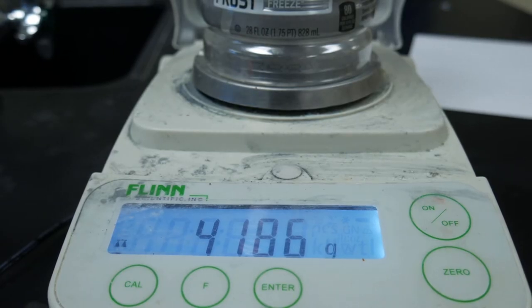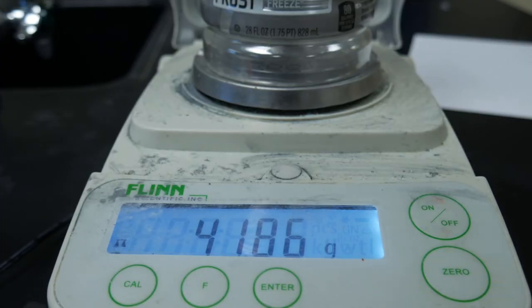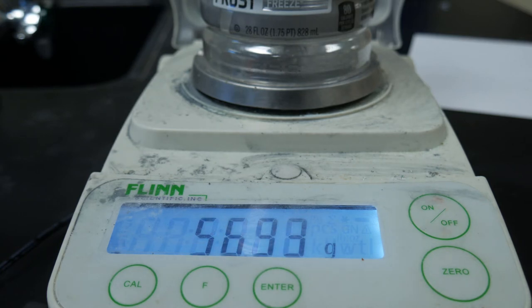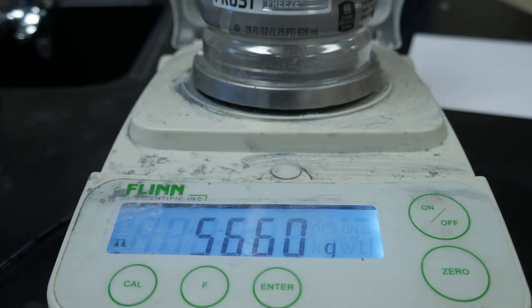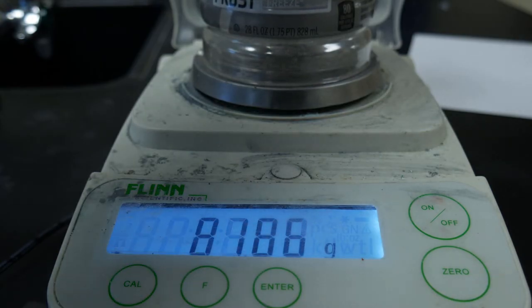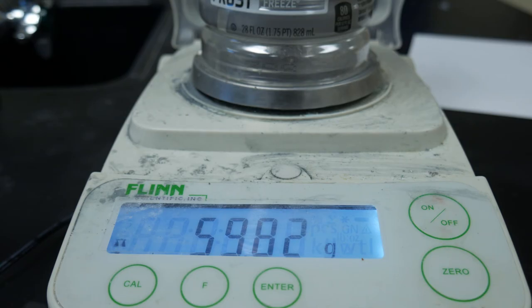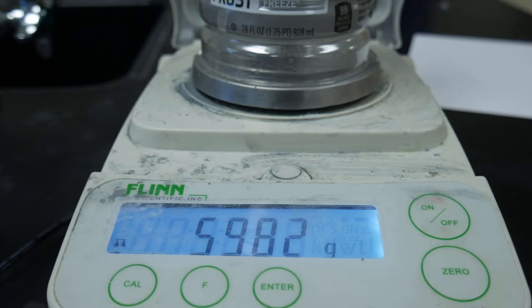We're going to add about 15 milliliters of vinegar to our bottle and record the mass of the bottle with the vinegar inside. We'll also put the cap back on so that way we don't have that mass missing. It looks like our mass is 59.82 grams, so record that as the mass of the bottle and vinegar in your data table.